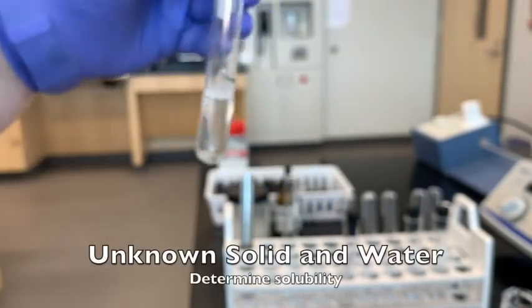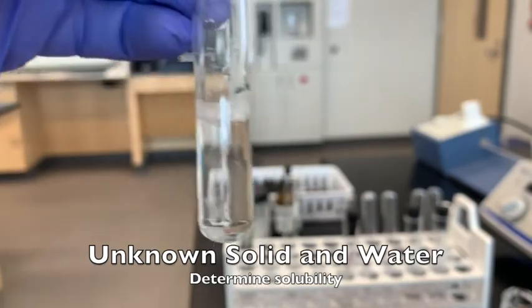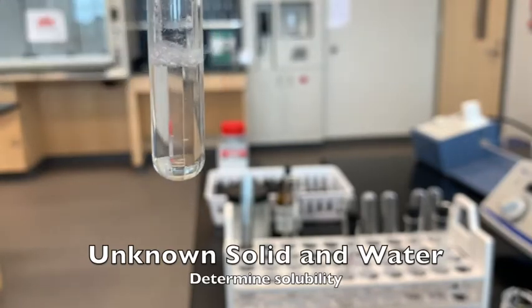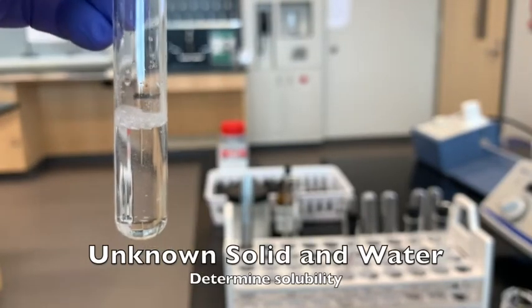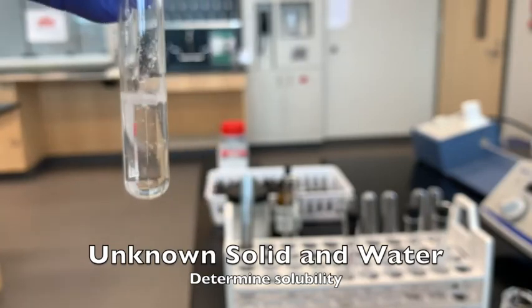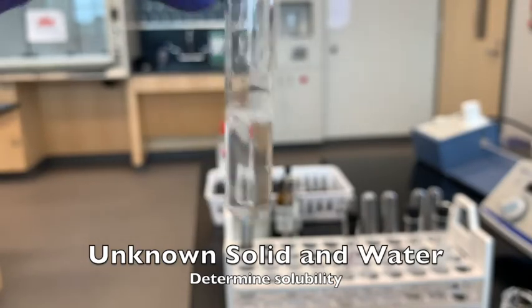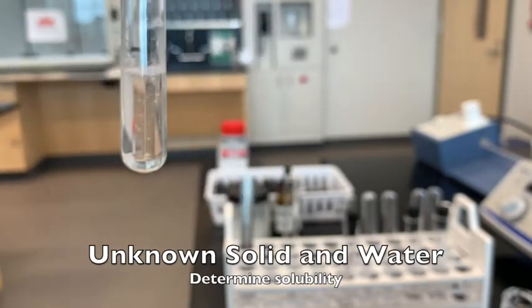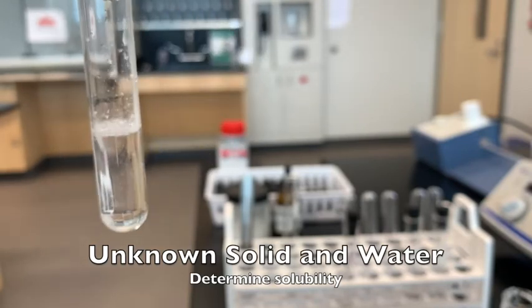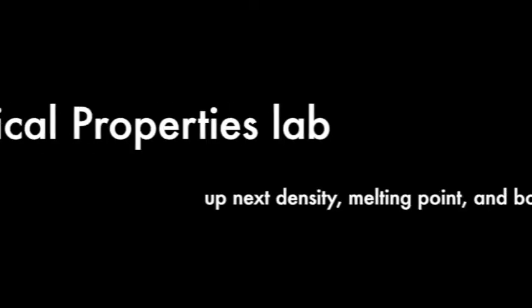We probably gave the other test tube enough time to settle too. This is our test tube with water and the unknown solid. You can see the unknown solid — it was at the bottom of the test tube and now it's floating inside the water. When I shake it, you can see the pieces move around. None of those pieces have gotten smaller — there's just as much of the unknown solid visible as when we started. You can decide whether it's soluble, insoluble, or partially soluble.